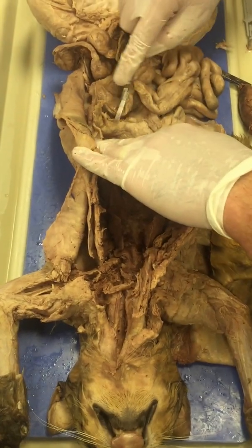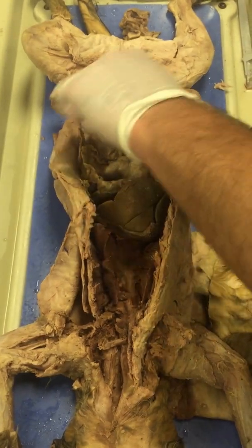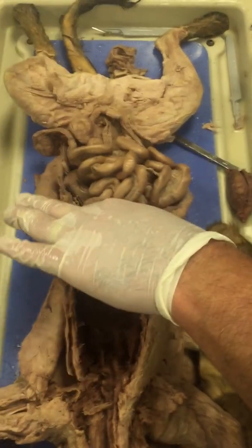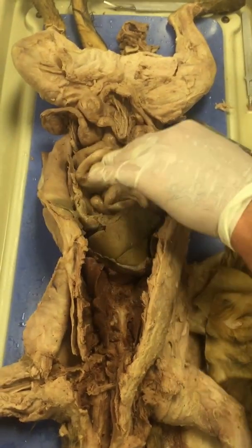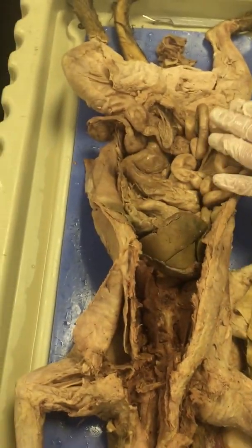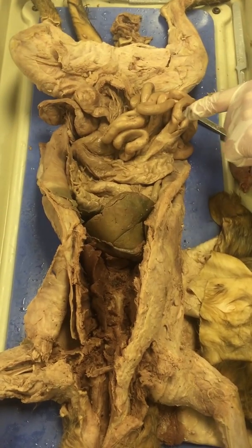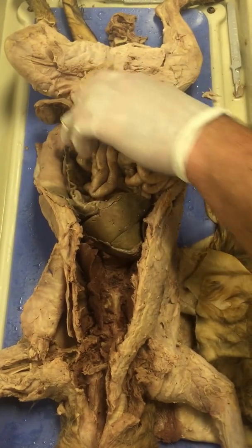The pancreas, which, remember, helps regulate blood sugar. It also secretes some other enzymes that continue the breakdown of materials once they enter the small intestine. It also dumps its contents into the duodenum, really close actually to where the bile duct enters. Small intestine: primarily responsible for absorption of the nutrients and continued breakdown of all the macromolecules. The large intestine: removal of water, removal of the last little bit of nutrients, and then defecation, elimination of waste.